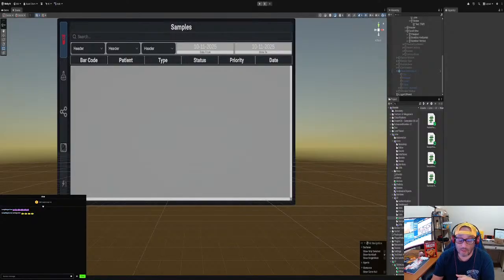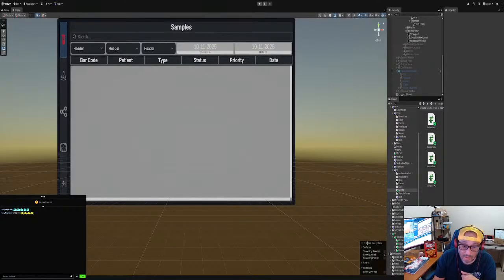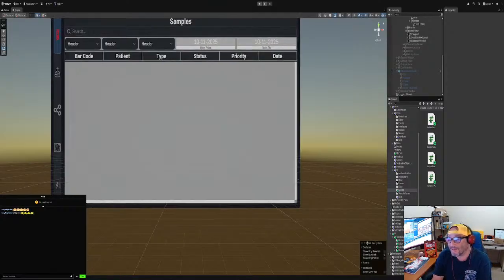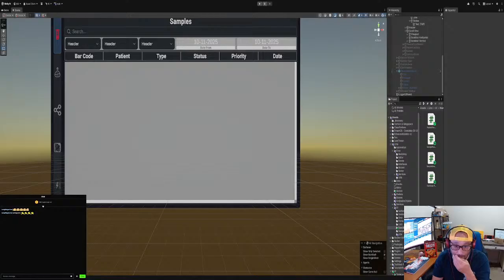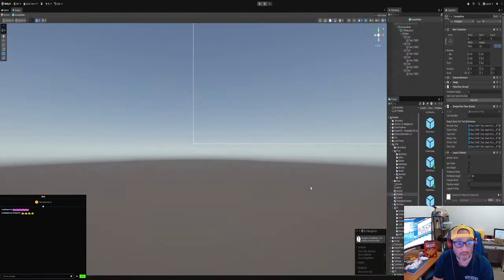So basically, what I did was, let me see, I made a prefab of how the row was going to look, which looks exactly like the header. So I just made a header first, and then I copied it and made that into a prefab, and that's how I got it done. Let me find the prefab. Sample row, right here. I double click on that. Hopefully we get it looking right. There we go.